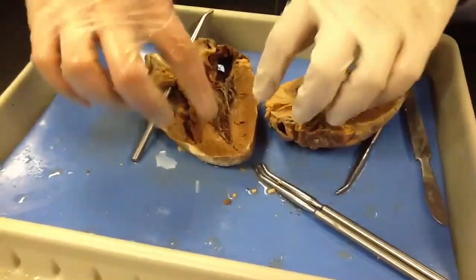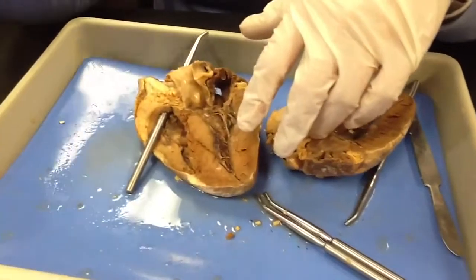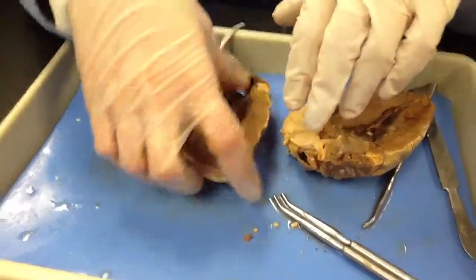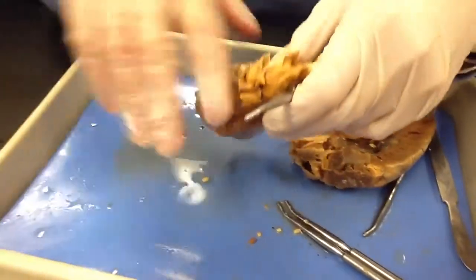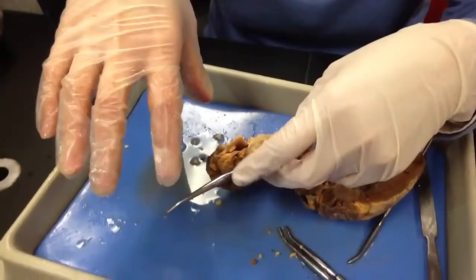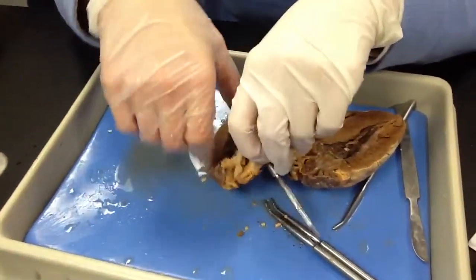Yeah, but whenever we get to the cat, we'll talk a little bit about what the cat has and what the cat doesn't have compared to what we have. There are a lot of things you'll be able to see. That's the reason I want you to know the main blood vessels, because of how they cut it. With the cat, the veins and arteries are dyed though, right?